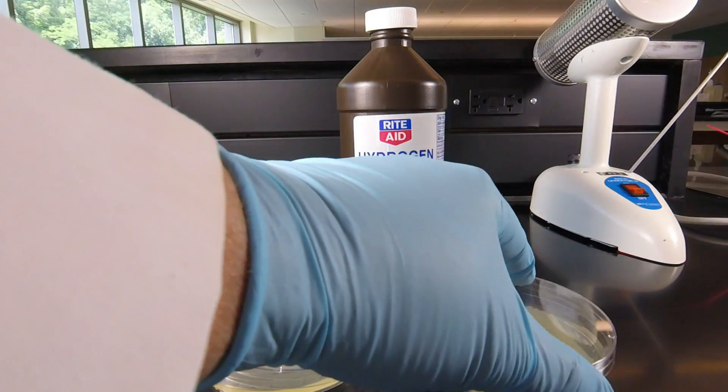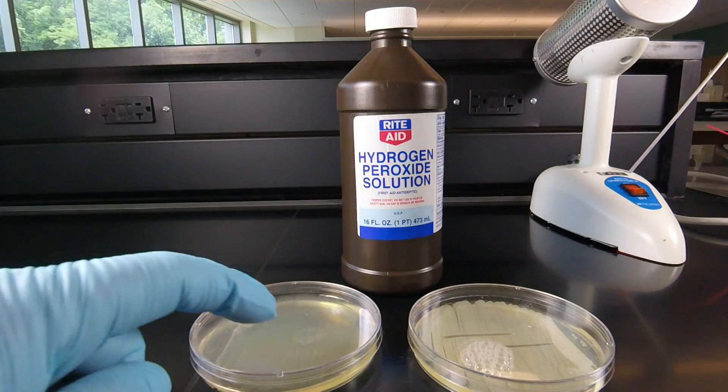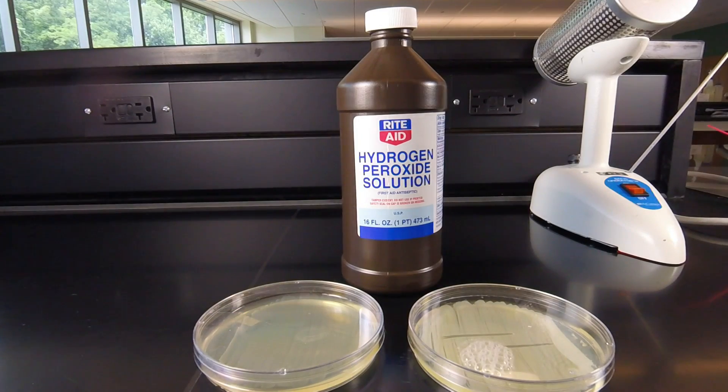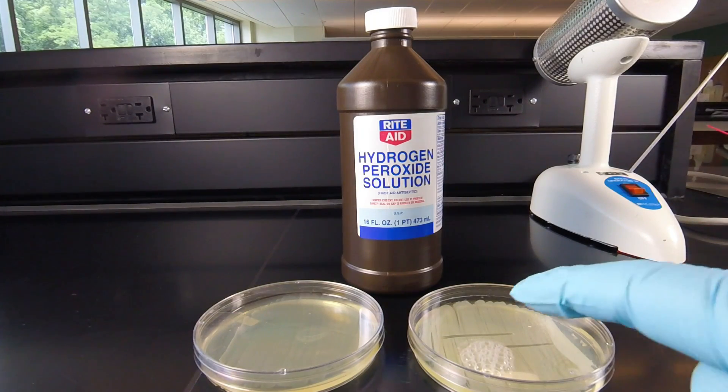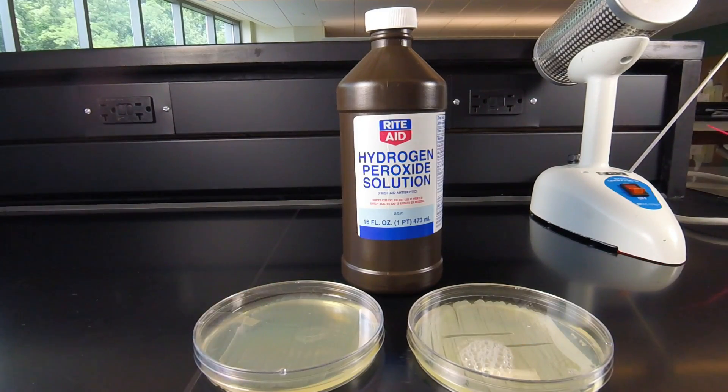So that's all that's really involved in the catalase test — adding a drop of hydrogen peroxide and looking for the foaming or the lack of foam.